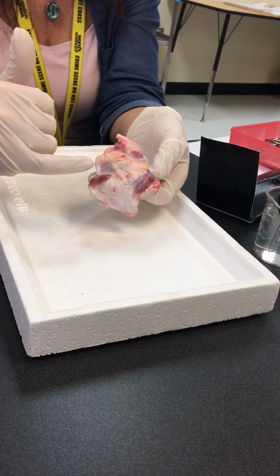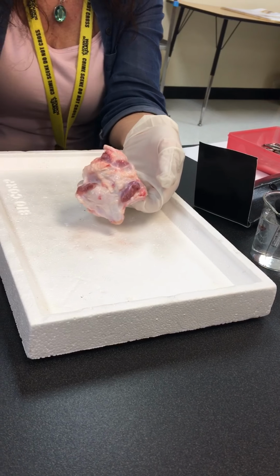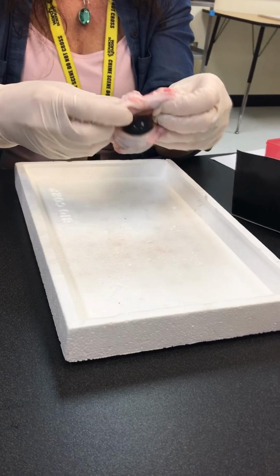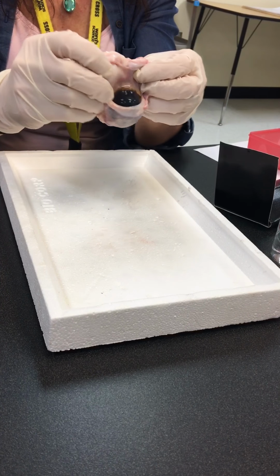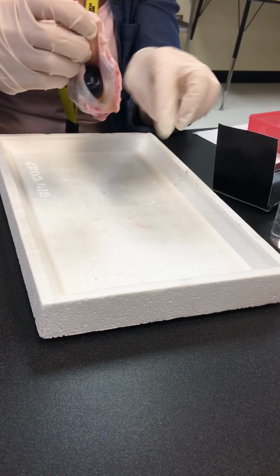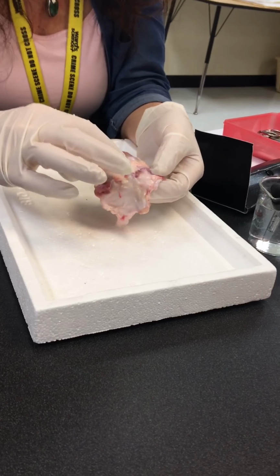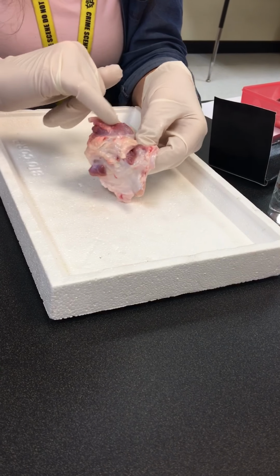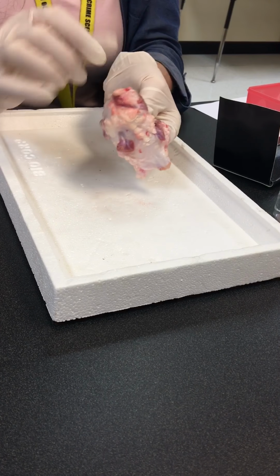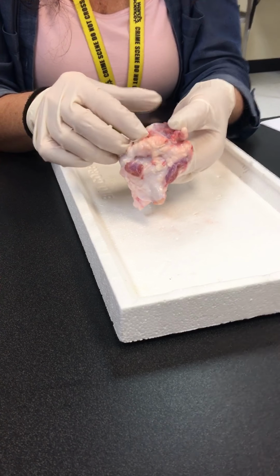How many are there? It's supposed to be six. Remember, we have one on the top, one on the bottom, for this movement here. So we've got two for this movement, and then two for this movement, and then we've got the oblique ones, so it'll attach but go around on both sides. So you're seeing some of those muscles here. You can see where they attach back there. We could probably locate most of those.